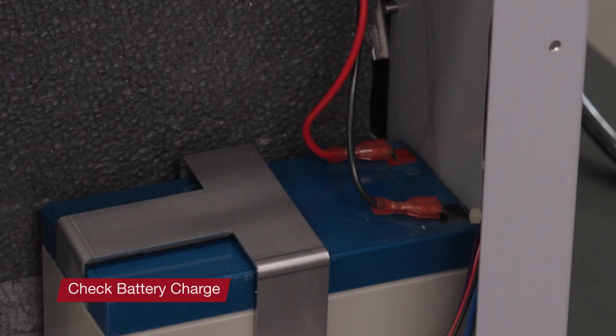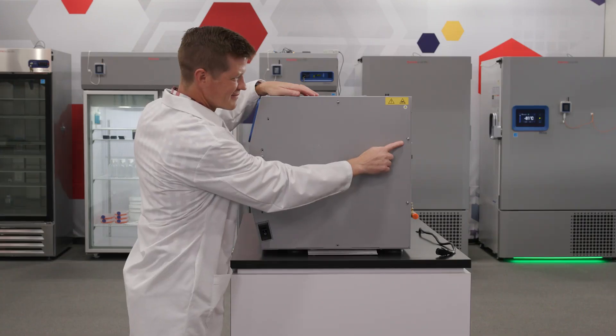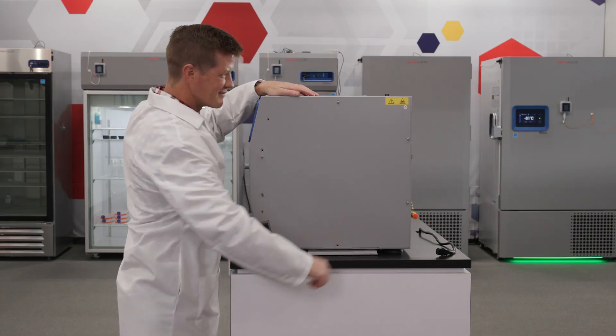Checking the charge on the battery unit should be an annual maintenance activity. If the charge on the battery is not meeting equipment specifications, you may need to replace it.